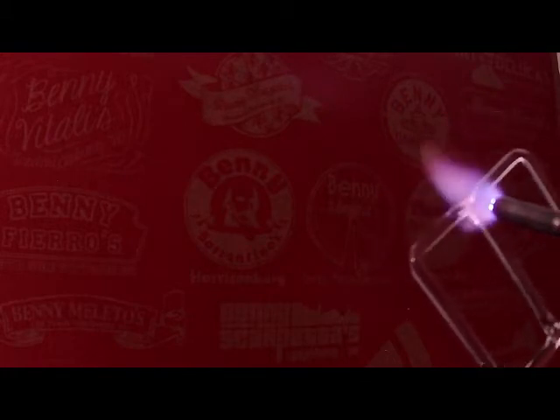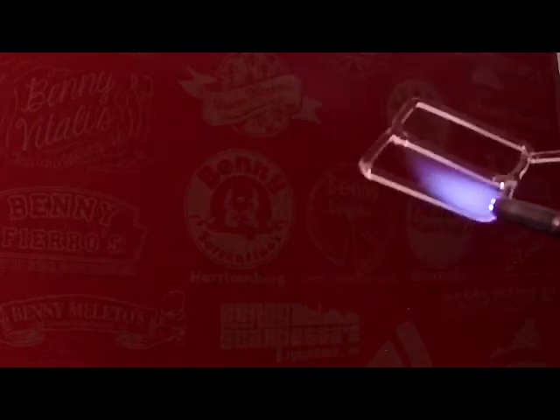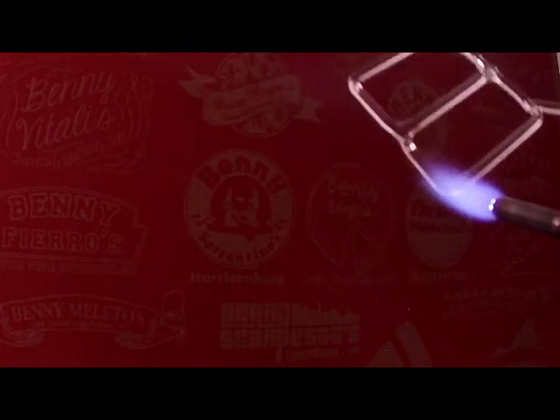In other words, if you make a bad seal, you'll see it very quickly. The other thing is with certain operations with 3 millimeter glass, for example, if I wanted to make marias with it, that's actually more challenging with the 3 millimeter than, say, if I was using 5, 6, 7, 8, and beyond. So it will force you to develop your technique.